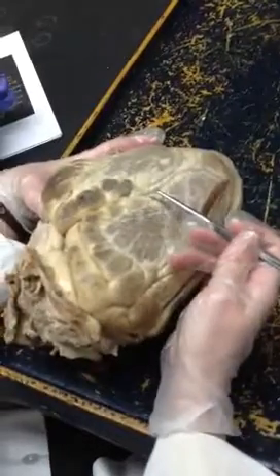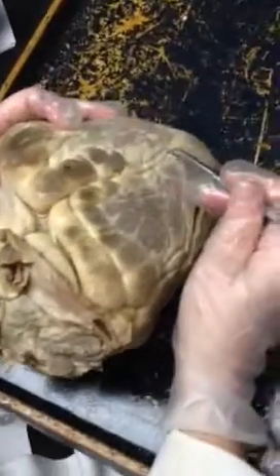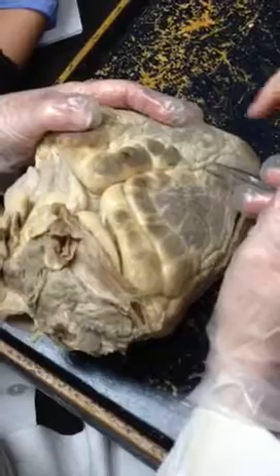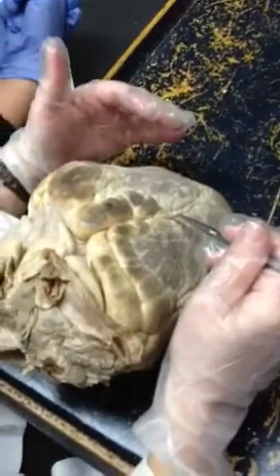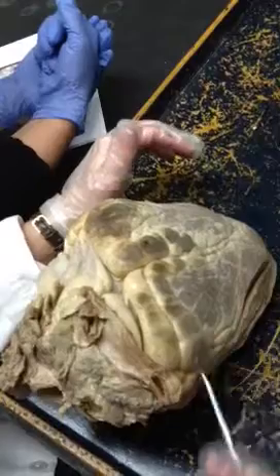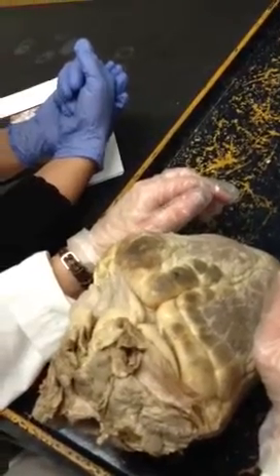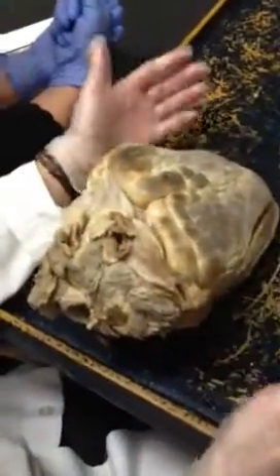If it's not a layer or a groove but it's still right here, then we want a coronary vessel, because that's what that is. The coronary sulcus goes around this way, and the coronary vessel sits in the sulcus. So if it doesn't say layer, it's a vessel that sits in the groove. If the card says 'groove,' you put ventricular sulcus or coronary sulcus. If it says 'layer,' you say epicardium.